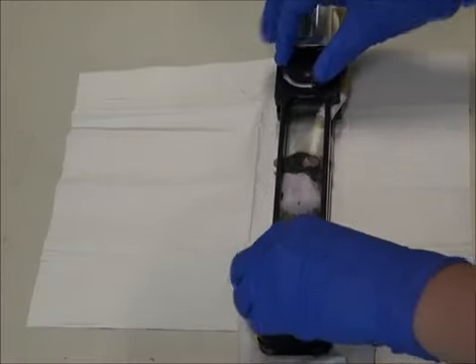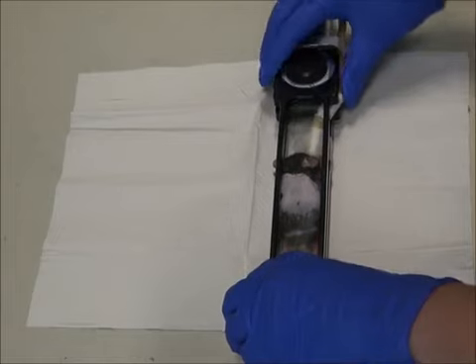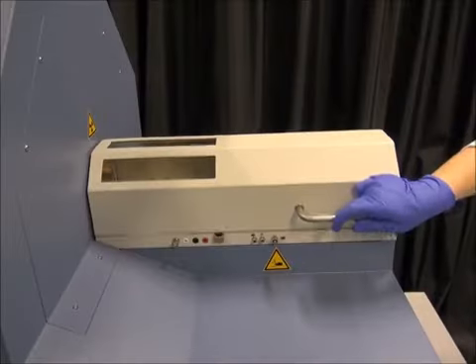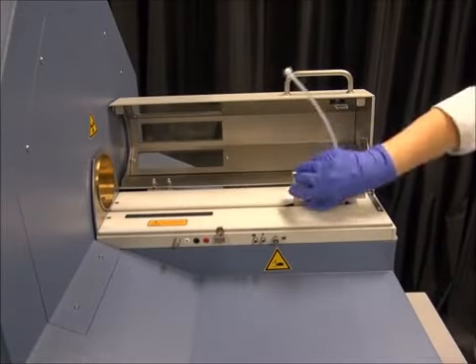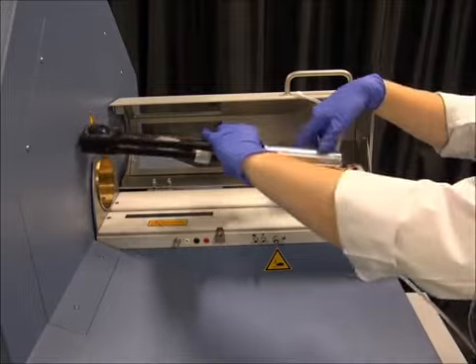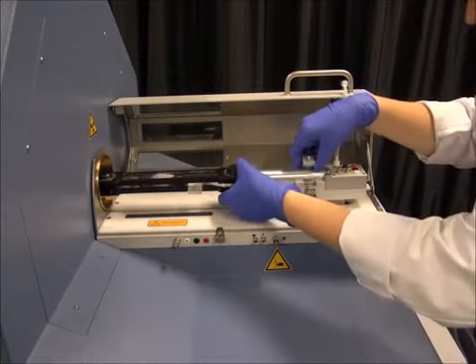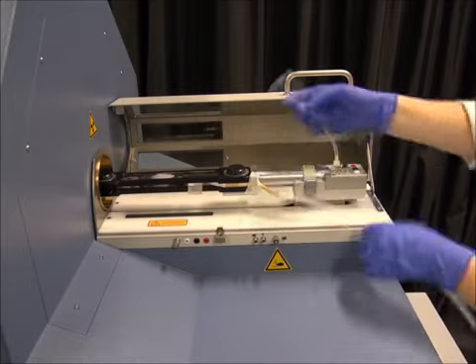It should be checked that the mouse breathes properly. And, if necessary, the mousebed should be adjusted accordingly. Then the mousebed is placed inside the µCT. The tubes, which transport the isoflurane gas, are switched to maintain the gas flow inside the device.